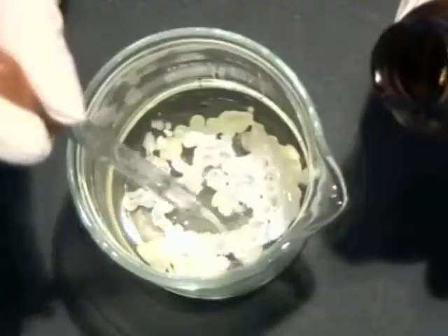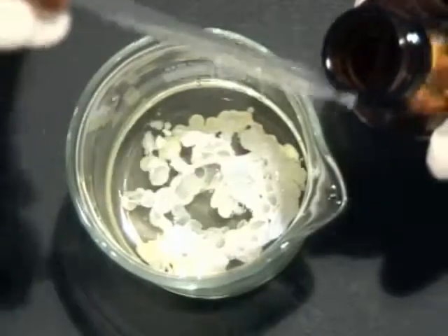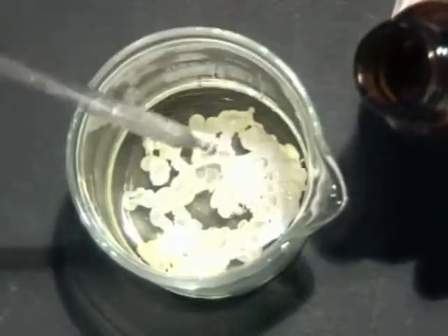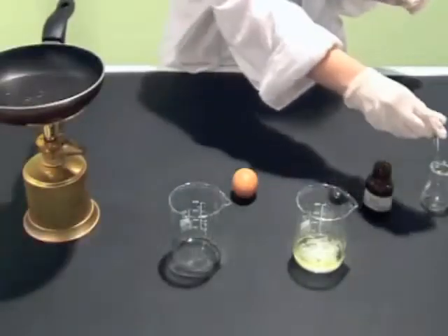The hydrochloric acid dramatically affects the pH of the albumin's environment and destroys the hydrogen bonds that stabilize the structure of albumin molecules.